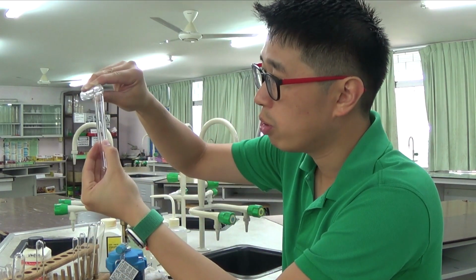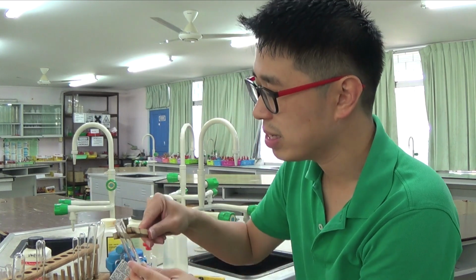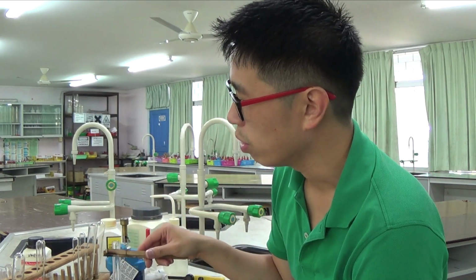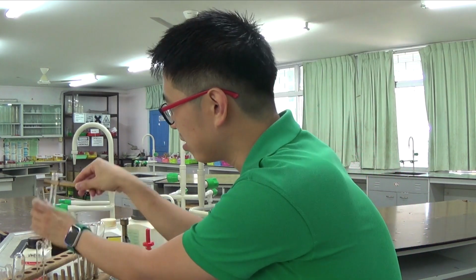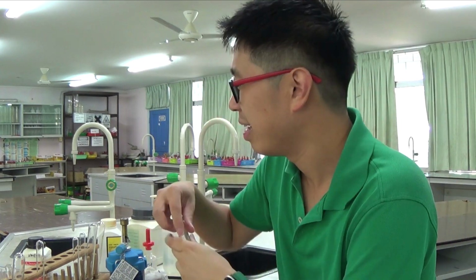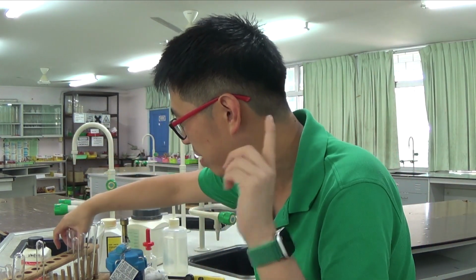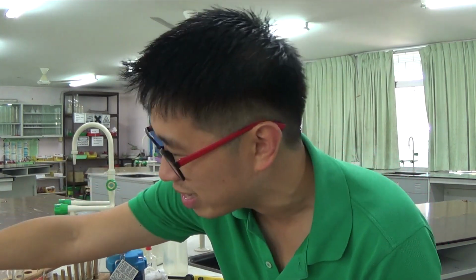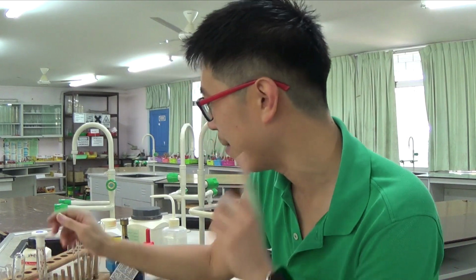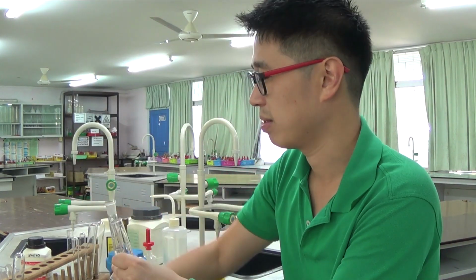I put it into two portions. Let me just test for nitrate. Oh wait, hang on. This is ammonium chloride, so this doesn't make sense. No, sorry, these two are ammonium chloride. I must not confuse myself. I said I wanted to test for ammonium nitrate. This is ammonium nitrate, so I will test for ammonium nitrate first. I have got to use this stock solution.